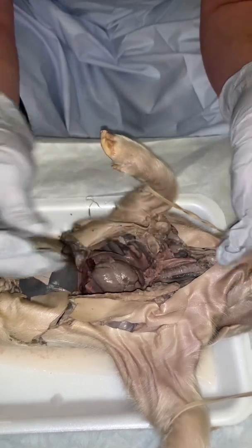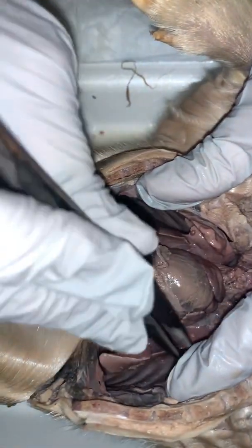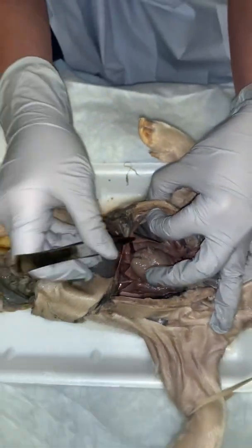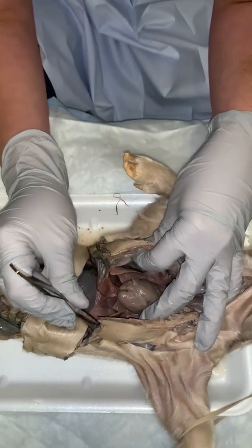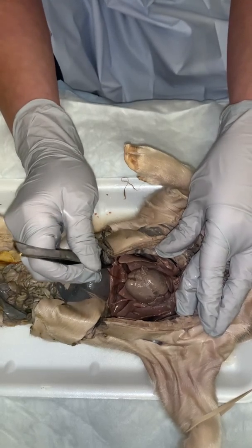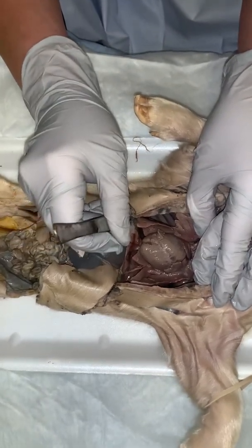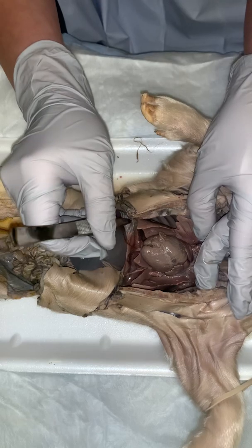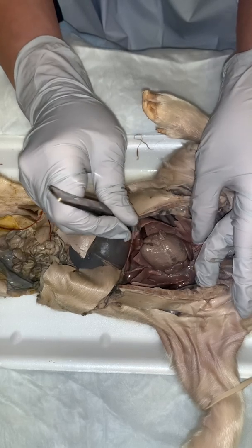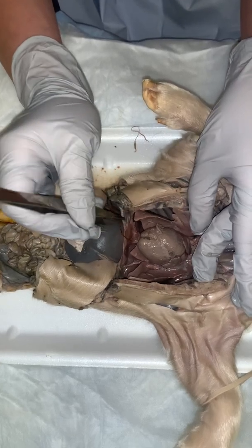Okay. And then our diaphragm sits right here below the lungs, separates the respiratory cavity from the abdominal cavity. The diaphragm. And the diaphragm, when you inhale, the diaphragm is going to contract and it's going to flatten, and the chest cavity enlarges, and this contraction creates a vacuum and it pulls air into the lungs.